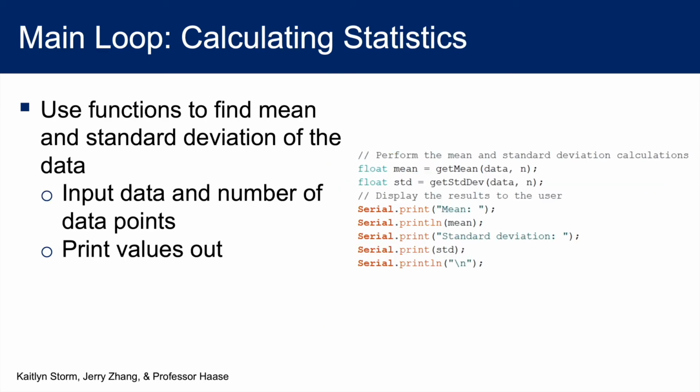We will now calculate the mean and standard deviation of the data, so we will use the functions we made earlier with inputs of the list of data points and the number of data points. We'll print these two values out.